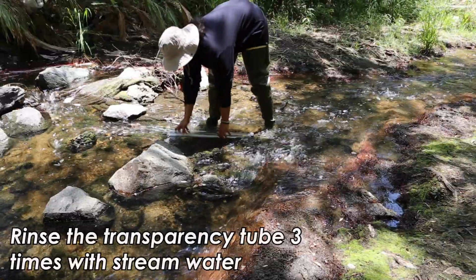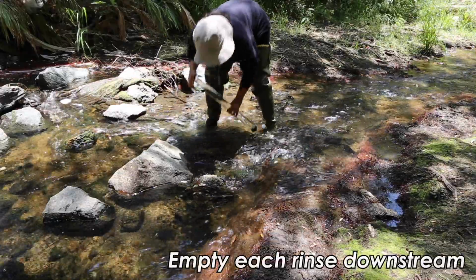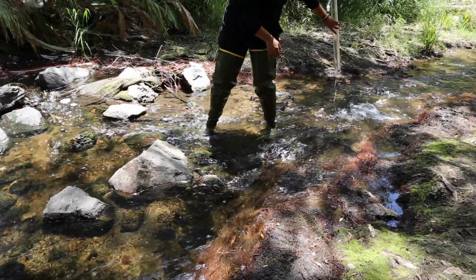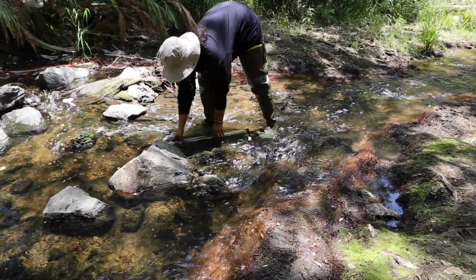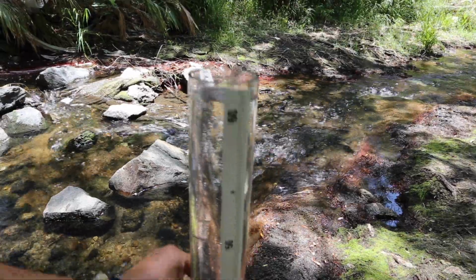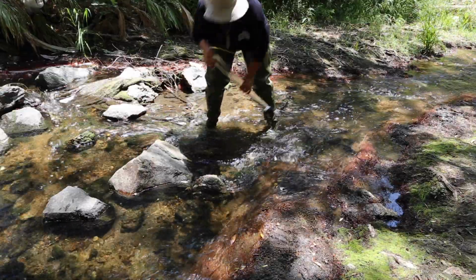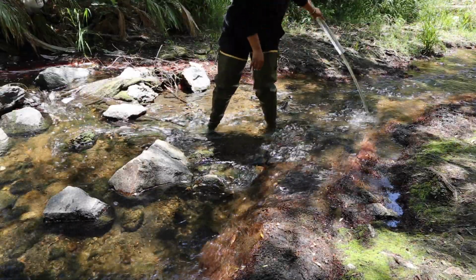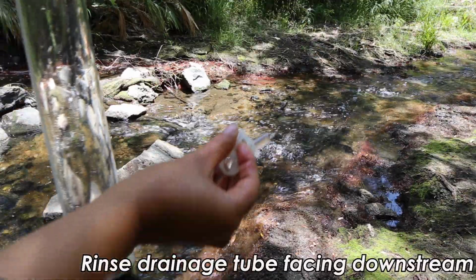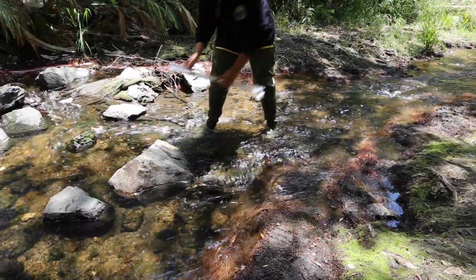To do this, rinse the transparency tube 3 times with stream water. Empty the rinse downstream. Hold the tube horizontally, parallel to the stream bed, in the middle of the stream's flow and allow the tube to fill to the 60 centimeter mark with water. Empty it downstream behind you and repeat this step 2 more times. To rinse the drainage tube, open the clamp facing downstream and let the stream water flow through the tube at the bottom.